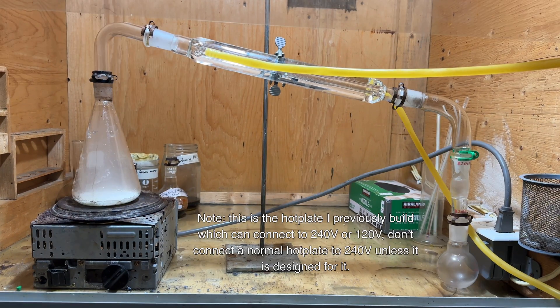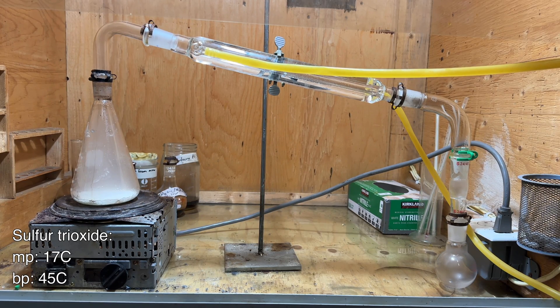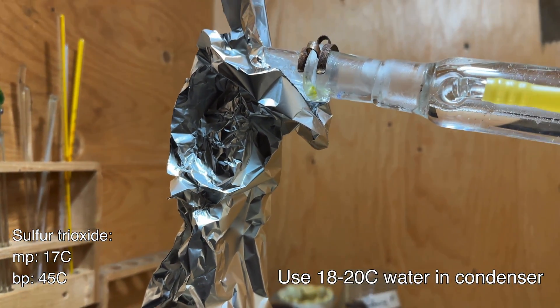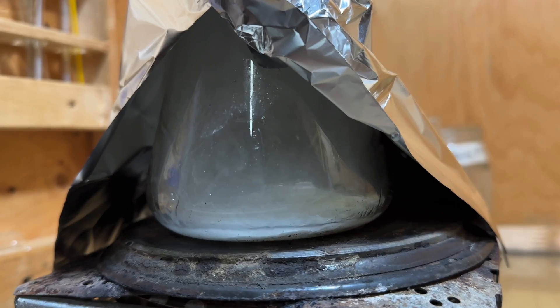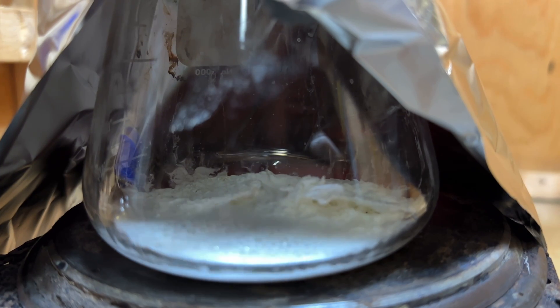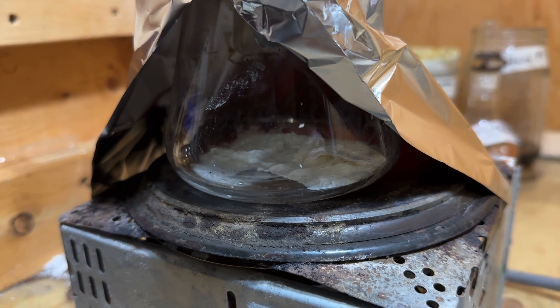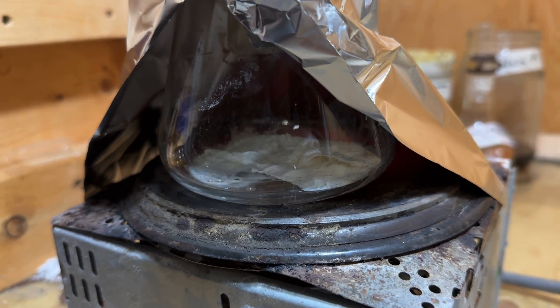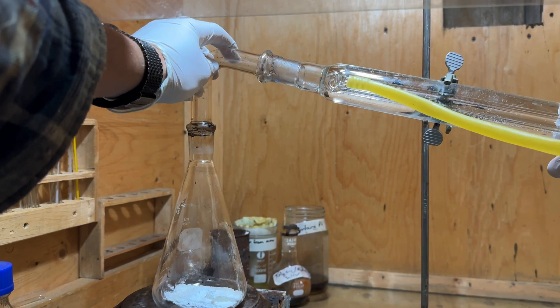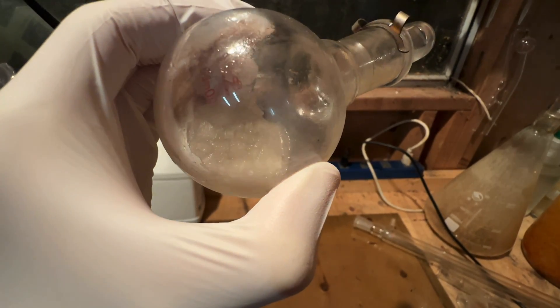The hot plate was then cranked to begin the decomposition of the tin(IV) sulfate. As a side note, sulfur trioxide has a narrow liquid range from 17 to 45 degrees Celsius, so it is necessary to use water around 18 to 20 degrees Celsius to prevent the sulfur trioxide from solidifying in the apparatus. As the reaction was heated, the tin(IV) sulfate decomposed into sulfur trioxide and tin(IV) oxide. A stoichiometric excess of sulfuric acid was used, so the remaining sulfuric acid also vaporized and distilled over. The flask was heated until the hot plate was glowing to ensure complete decomposition, and then the product was stoppered and the apparatus was allowed to cool. While disassembling the apparatus, the characteristic fuming nature of sulfur trioxide was observed. As the product cooled, it also crystallized to give some beautiful sulfur trioxide crystals.